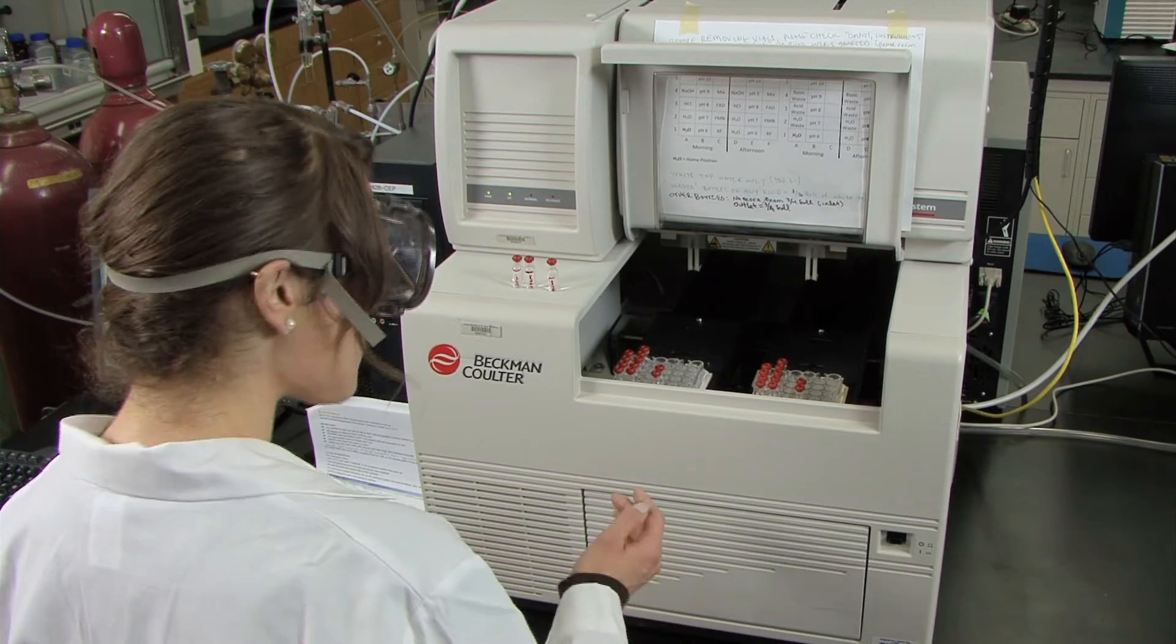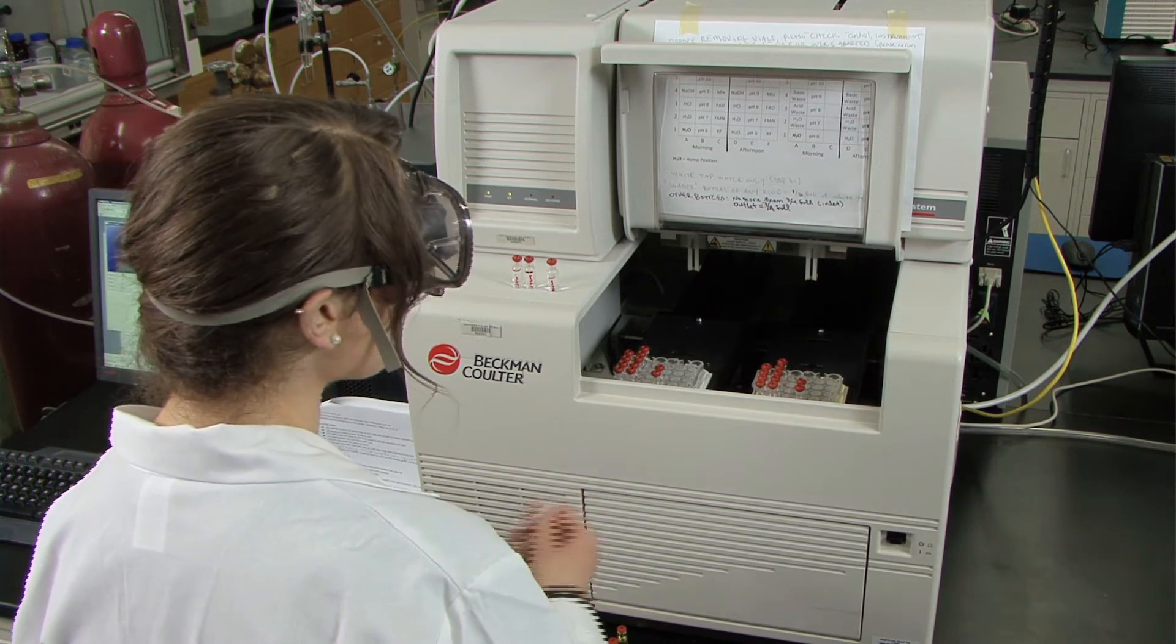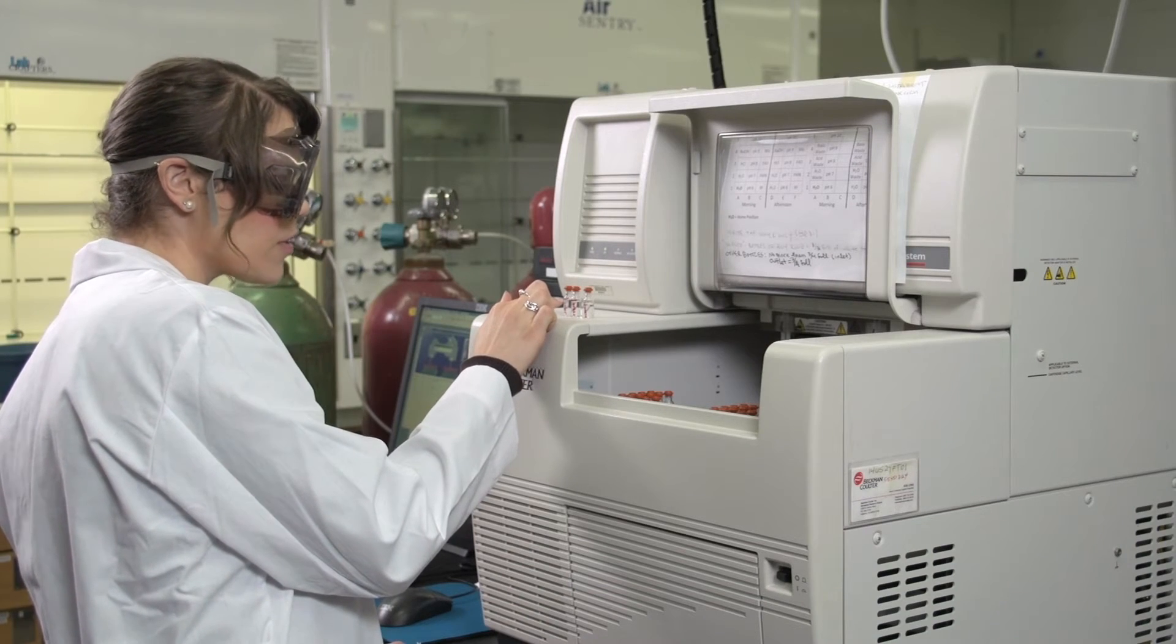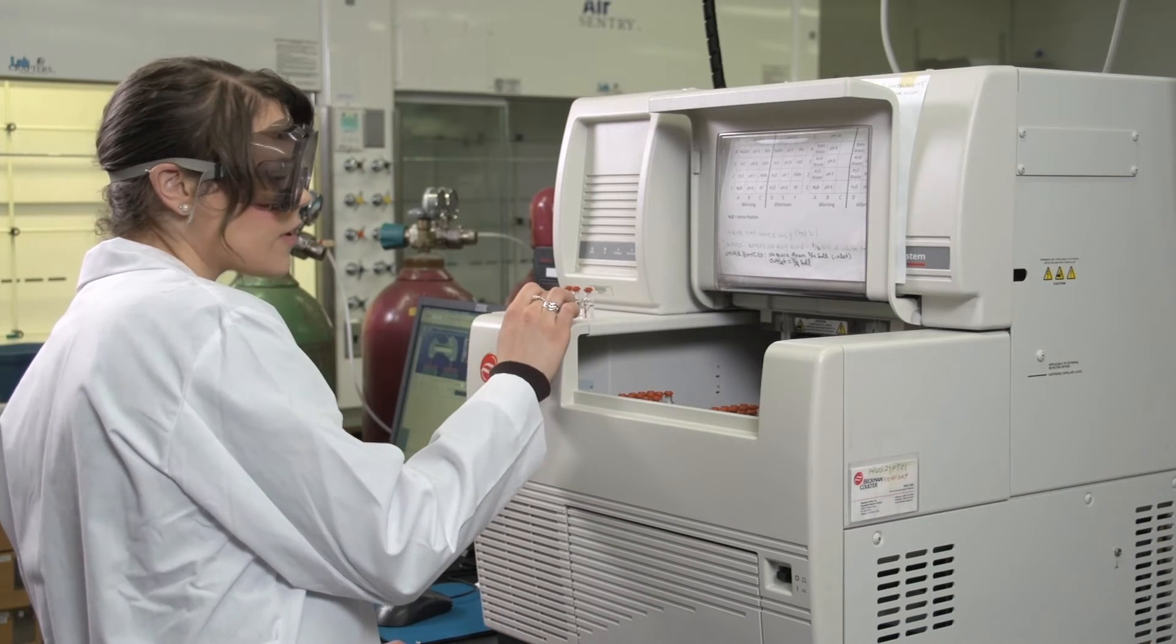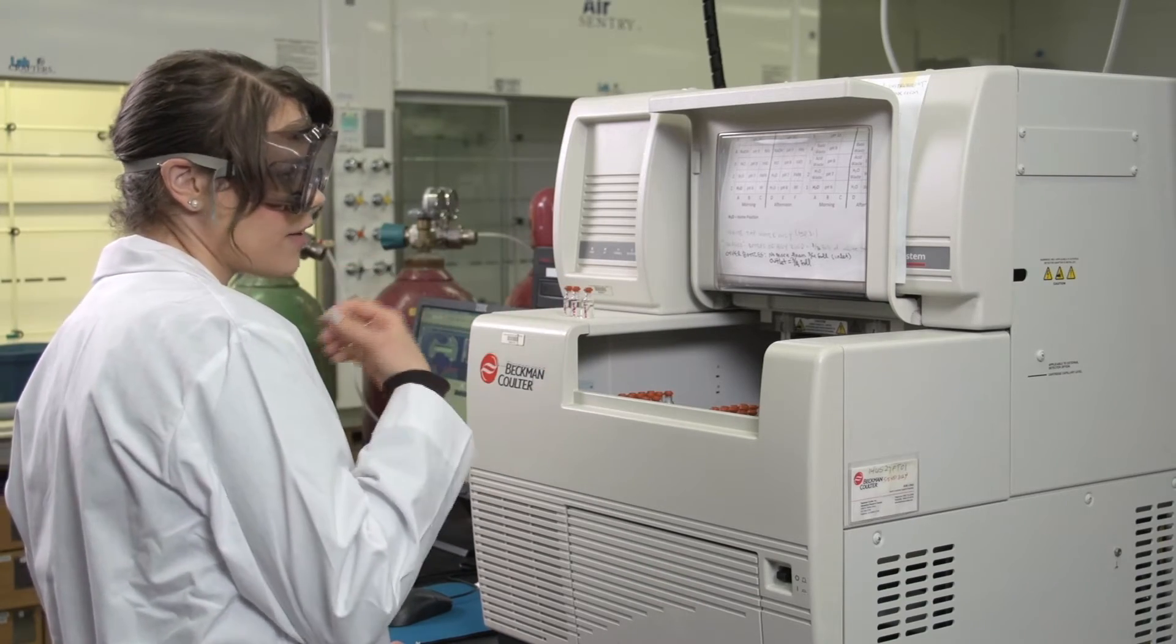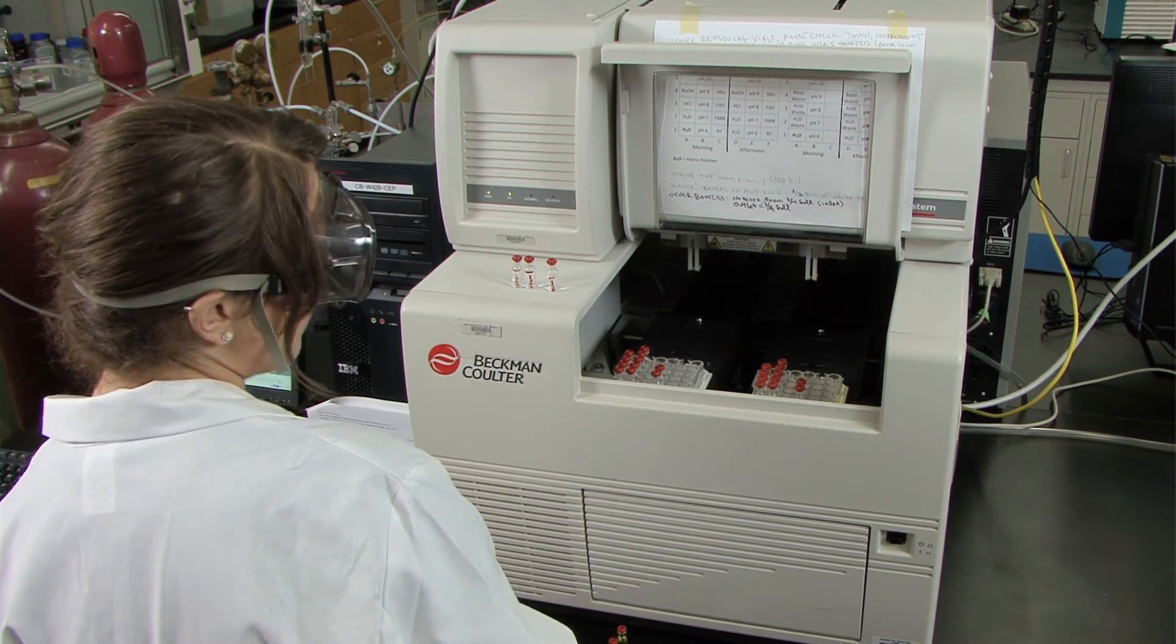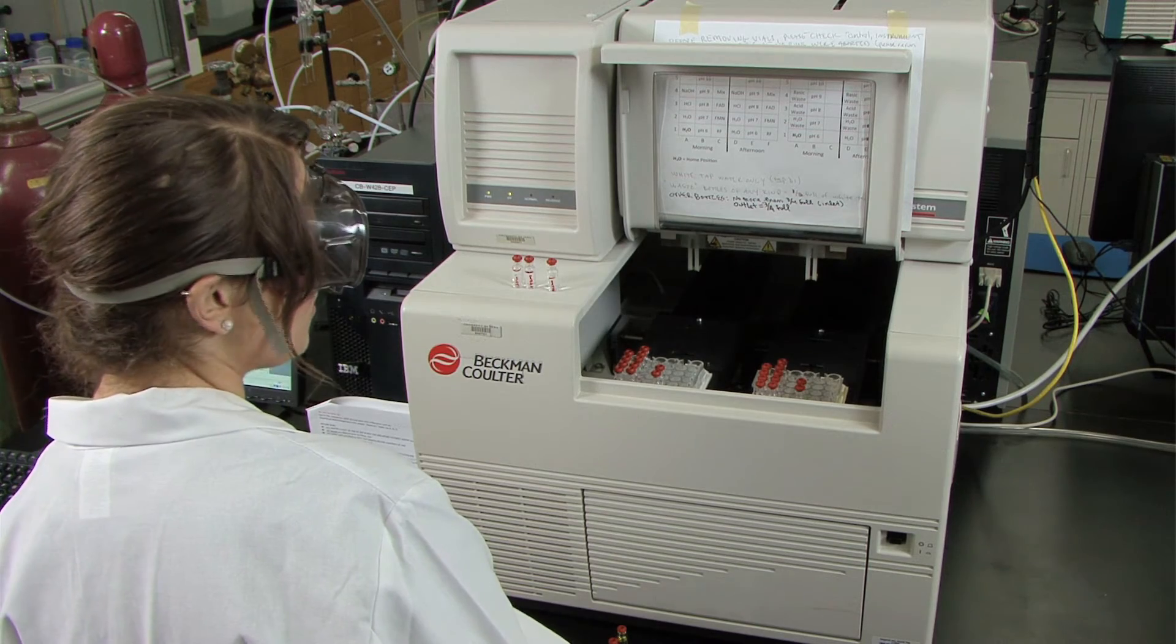Before you load your vials into the capillary, you want to make sure that they are filled to the proper amount. For vials that are for the inlet, they need to be filled approximately three quarters of the way full, but below the shoulder. For the outlet, they need to be filled a little bit less because there will be solution that is injected into the vial. And for the waste, you need to fill that only about two thirds of the way full. Any of the waste vials that you fill just need to be filled with distilled water.